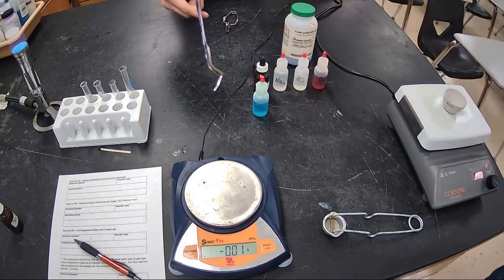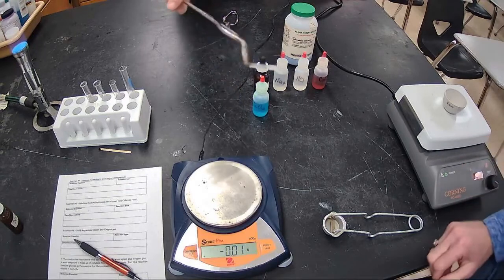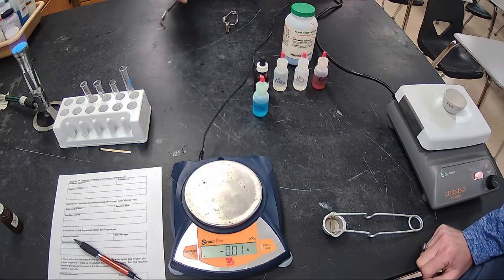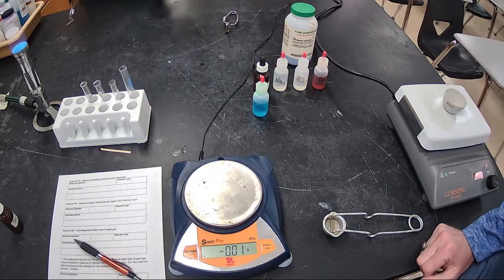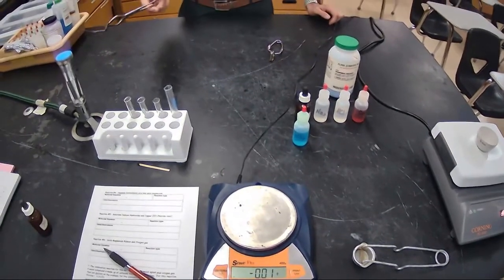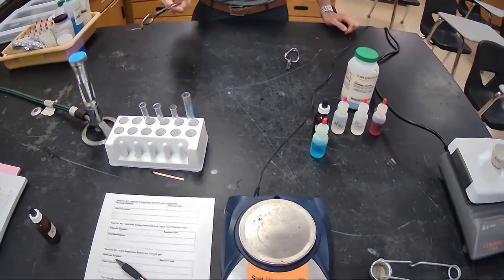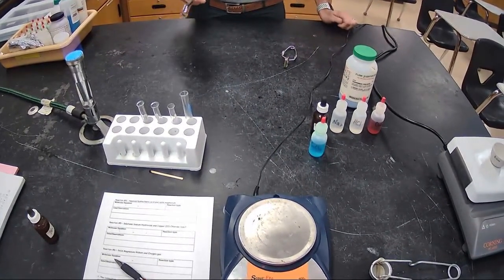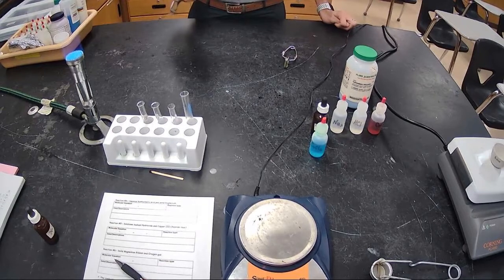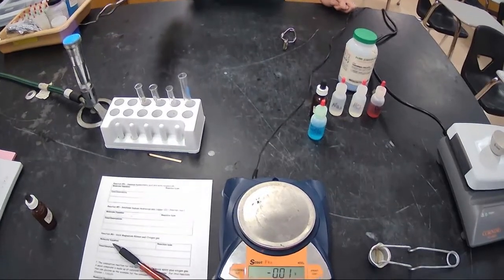You didn't think that metals could always burn, but if it has enough surface area and is thin enough, it will ignite and catch on fire. And when it burns, it gives off a really, really bright, intense heat. You might want to turn the camera a little bit. One of the things firefighters have to deal with is that this burns so hot that you actually cannot put it out. You could put dry ice directly on this fire, and it would still burn through the dry ice.